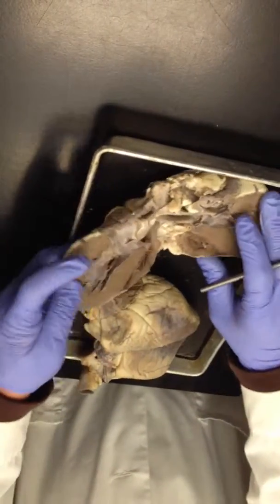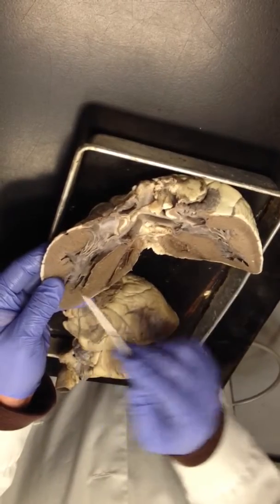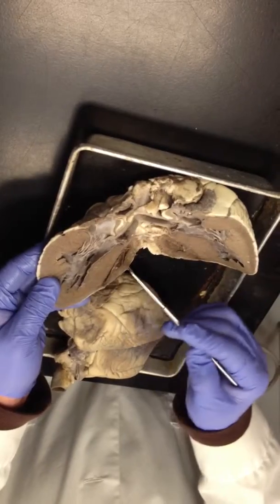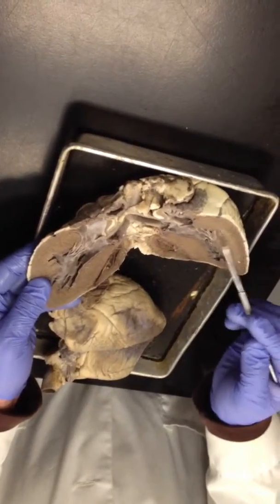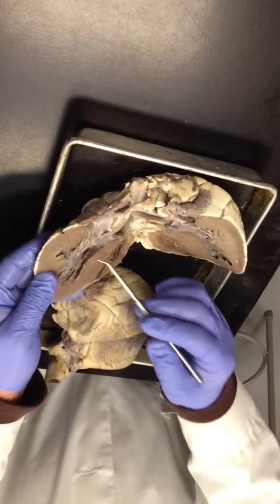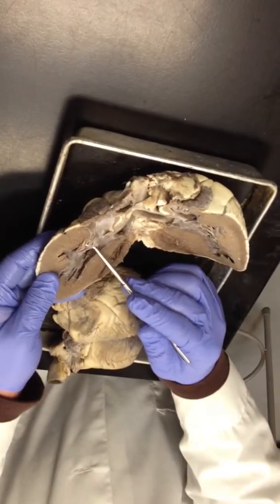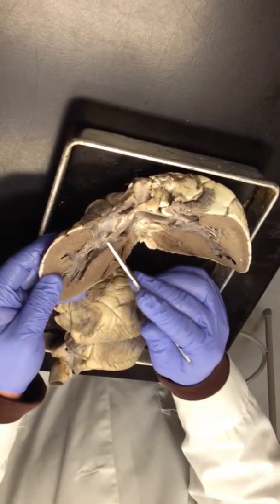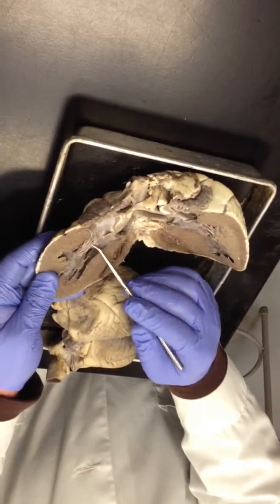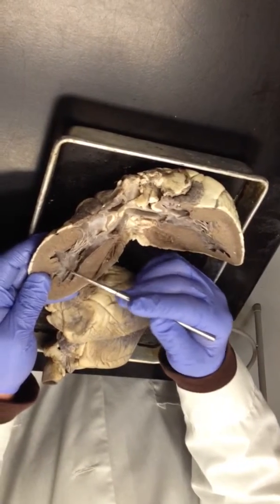wall of the ventricular musculature. So the side that has the thickest wall is left. The side with the thinnest wall is the right side. So this is the left ventricle, this is right ventricle. This is the left ventricle on this half, and this is the right ventricle on this half. We still see the chordae tendineae that comes off of the AV valves. Here's a cusp of the bicuspid valve with its chordae tendineae. And wherever the chordae tendineae insert in the wall of a ventricle, that is a papillary muscle.